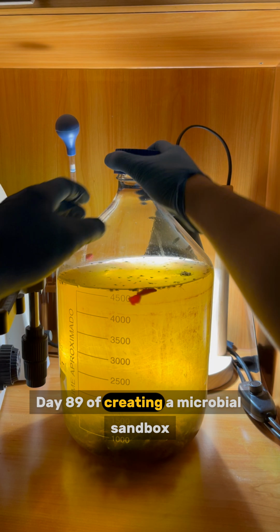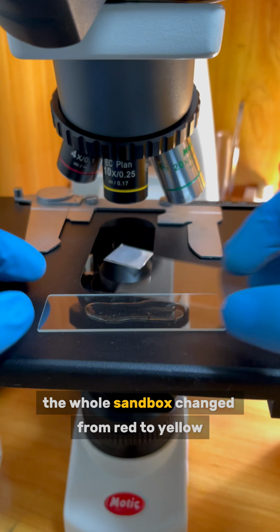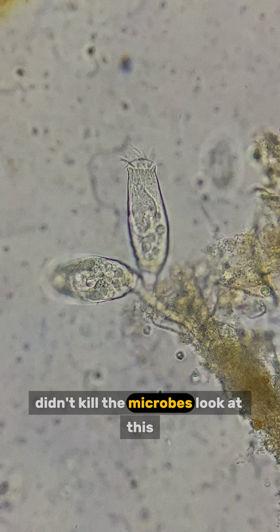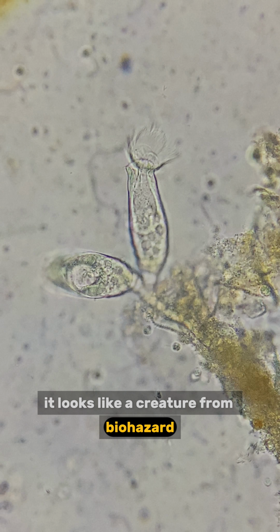Day 89 of creating a microbial sandbox by adding random stuff and observing it under the microscope every day. By the way, the whole sandbox changed from red to yellow. And it seems that the activated charcoal didn't kill the microbes. Look at this. I think these should be a special species of Vorticella. It looks like a creature from Biohazard.